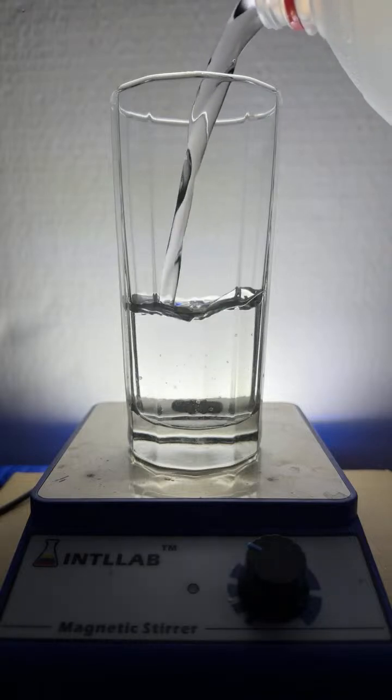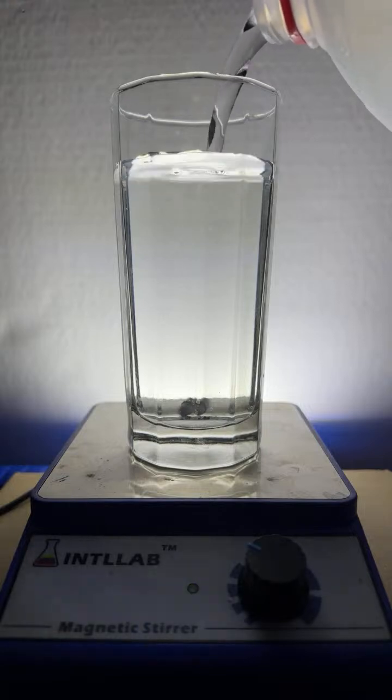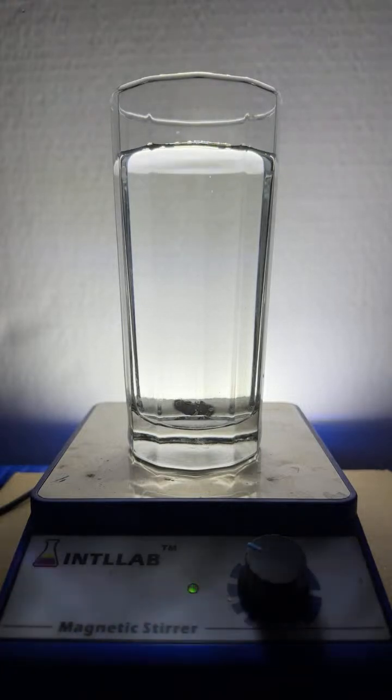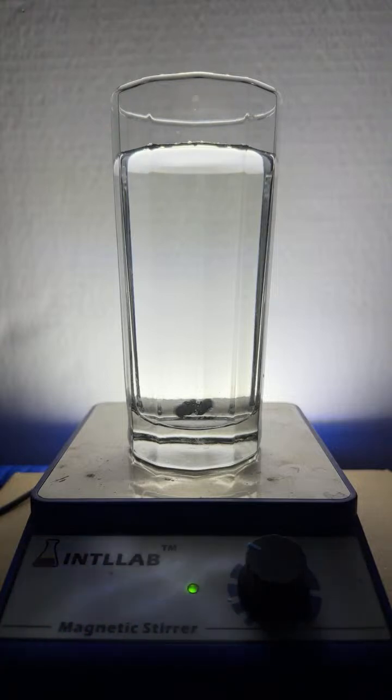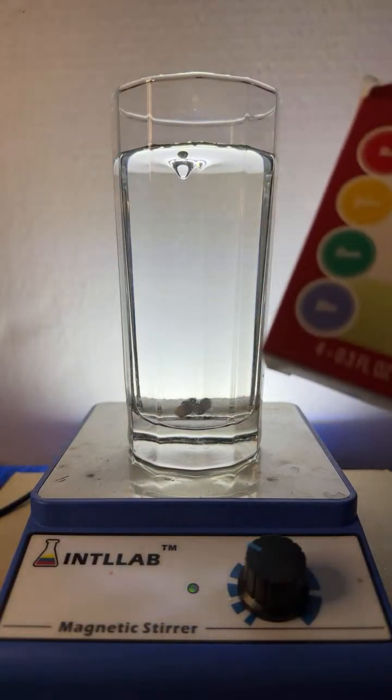So let's get this going here. A little bit of water. It's just plain old water. A little stir bar on the bottom. And then what we'll do is, I'm going to add some of the green food dye. Whoop, you can't see that. Let me turn this light on so you can see what I'm doing here. I've never tried these experiments before. I mean, I've used this as an acid-base indicator. I've just not tried it in this particular manner.